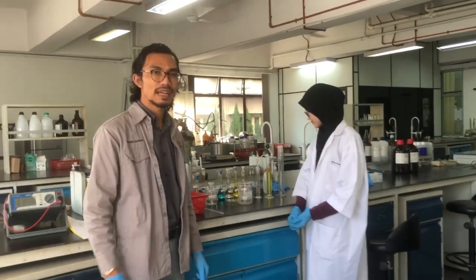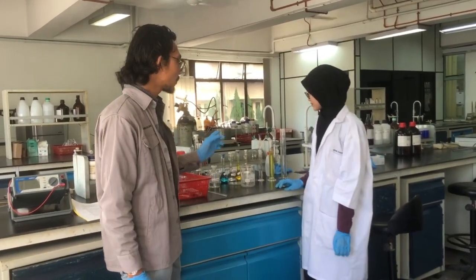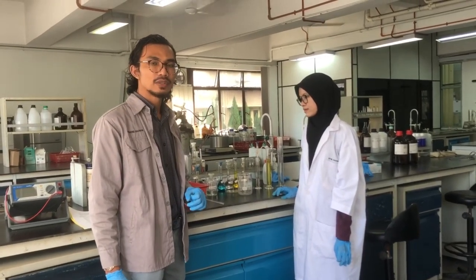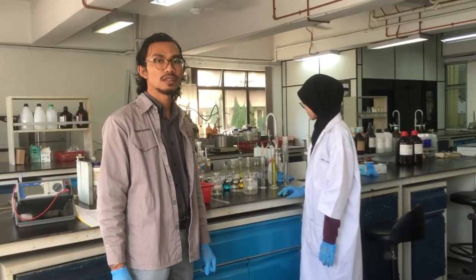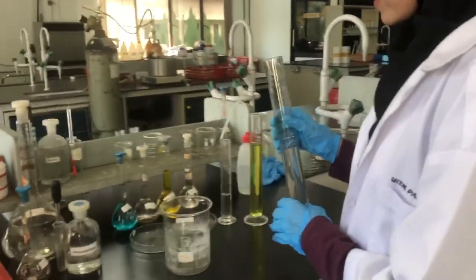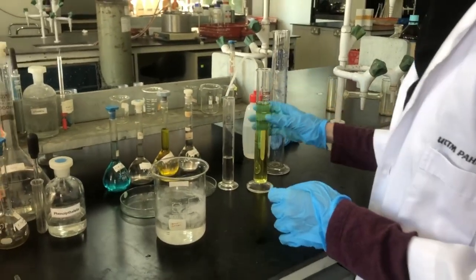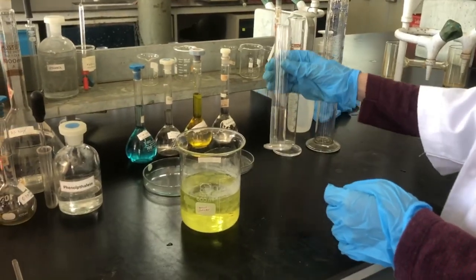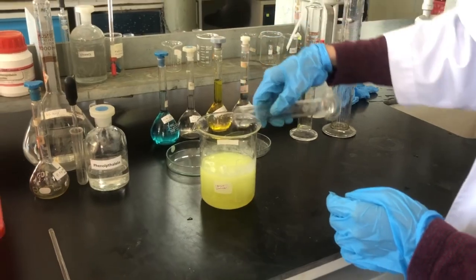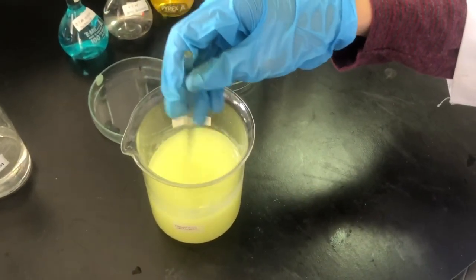Before we start Experiment A, we need to prepare the ferroxy indicator. The ferroxy indicator is prepared by mixing NaCl solution with potassium ferricyanide and finally phenolphthalein. The measurements are: 200 ml of 5% NaCl, 100 ml of potassium ferricyanide solution, and 20 ml of phenolphthalein solution. First mix the NaCl solution, then add the potassium ferricyanide, and finally add the phenolphthalein. Mix together using a glass rod to ensure the mixture is homogenized.